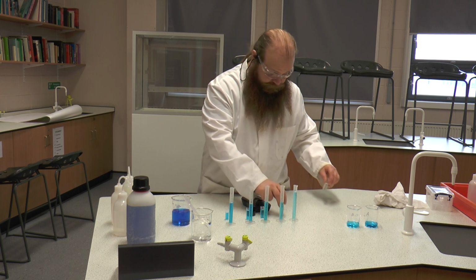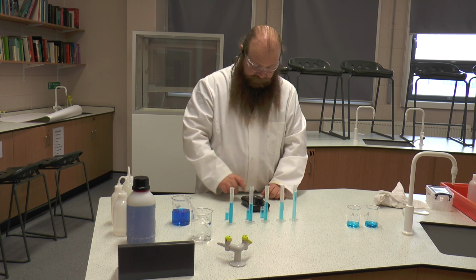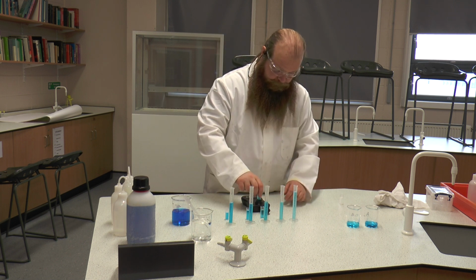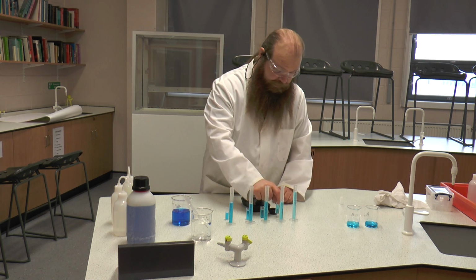Okay, now it's gone to sleep. So we're going to turn it back on, and we're going to do our reference. We're going to calibrate again. Okay. And this time we've got a reading of 15.1. You'll need to write that down.